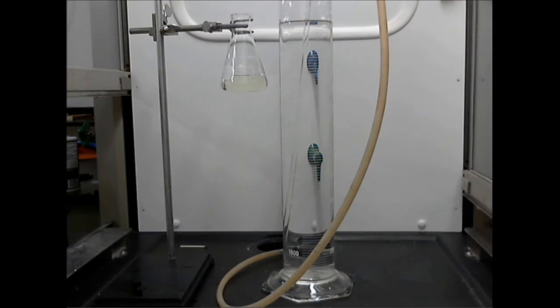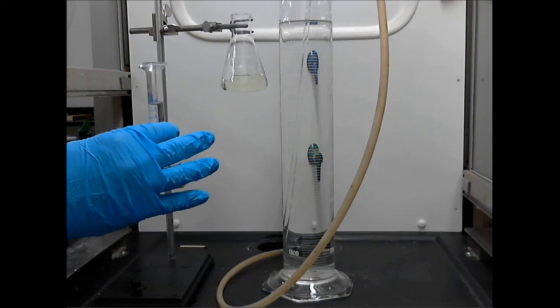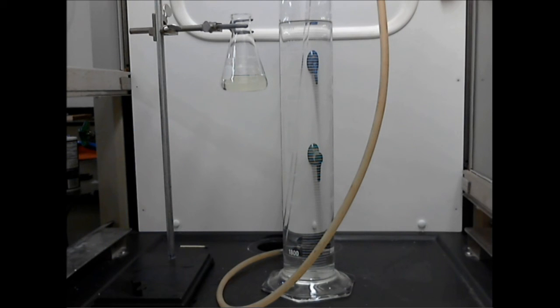So now I'm just about ready to show you the halogens group of the periodic table in all of its reactive glory. But let me just recap what's going on here. I have this flask filled with bleach, sodium hypochlorite dissolved in water. To that flask, I am going to add hydrochloric acid. Here I have 10 milliliters of hydrochloric acid that I will add to the flask. When those two chemicals react with each other, they are going to produce chlorine gas.